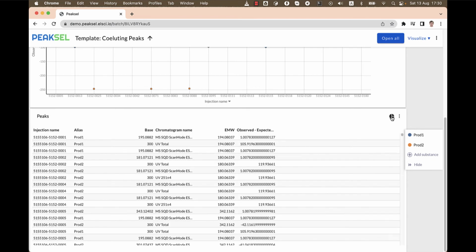Now it's going to be clear why we added chromatogram name as one of the columns. See, when Peaksel calculates a base for the peak, mass spec peaks will have their base peak mass as the value, but for UV peaks, the most abundant signal is called lambda max. It's the wavelength at which the compound absorbs light the most. And of course, it has nothing to do with the molecular weight of the compound. So these rows mislead us and we need to filter them out.